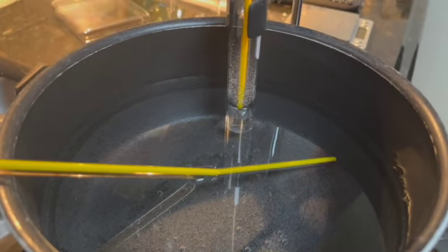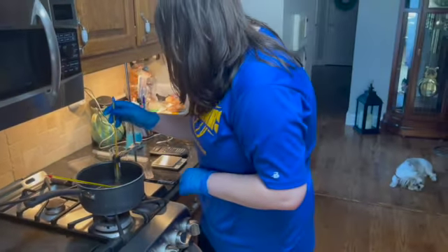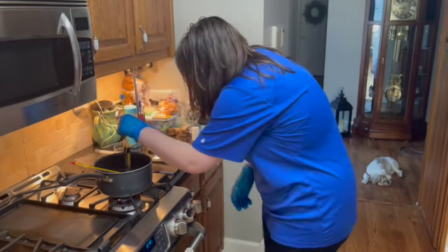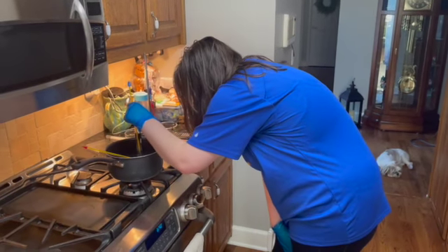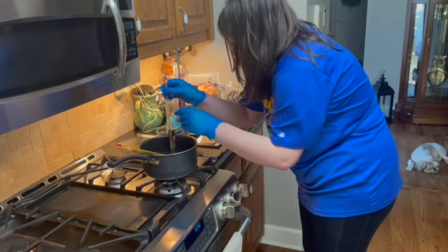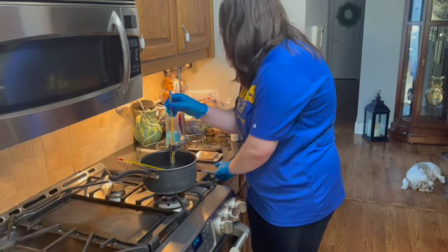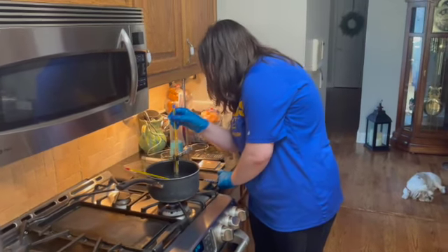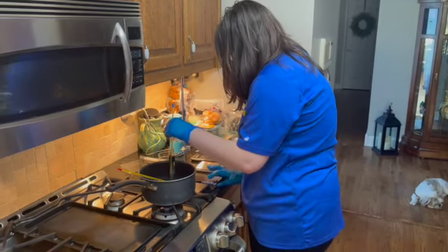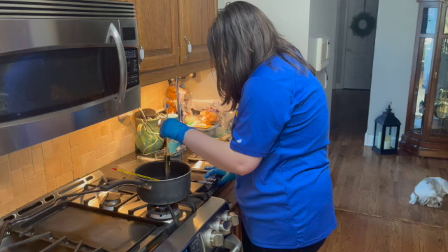Roughly around this 19-minute and 36-second mark, it is almost completely melted. I'm going to give it just a little bit more time to make sure, but it's basically almost all melted at this point. There's still a few crystallized flakes in there, but we've got to wait until it's completely melted. And turn back on my phone. Okay, it won't turn back on. Okay, so turn back on my stopwatch.